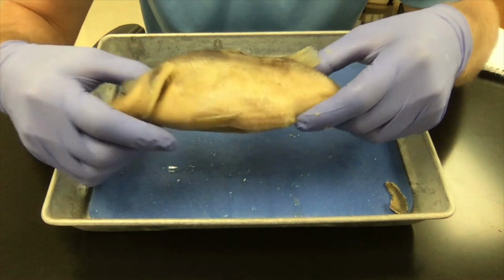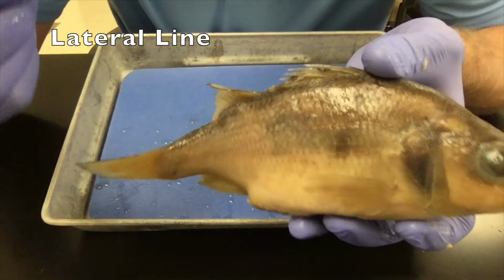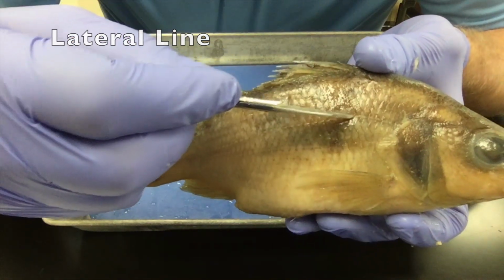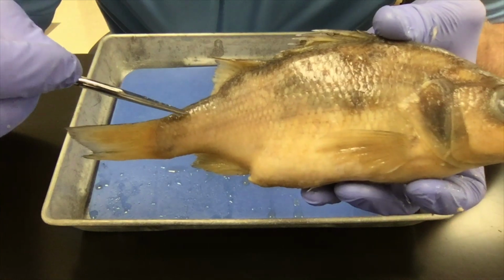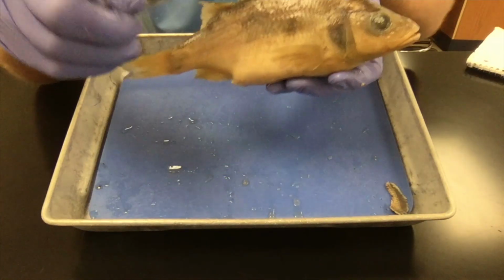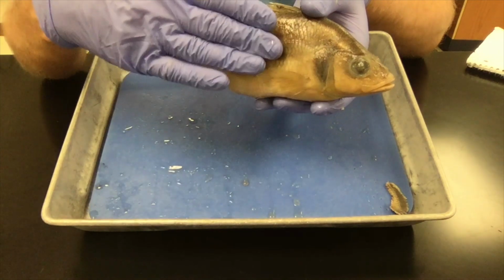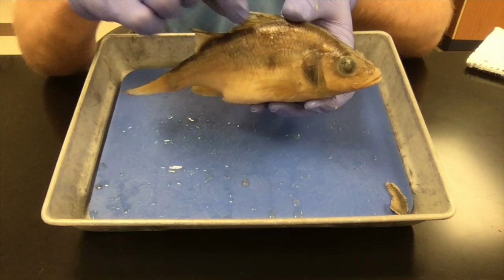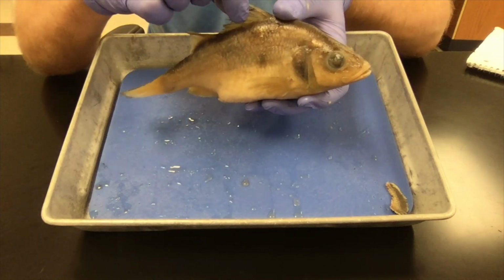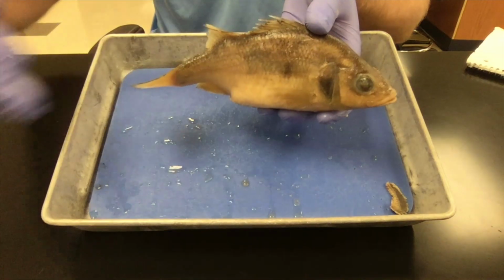Also on the outside of the fish is a unique structure called the lateral line. You can see the lateral line right here. It's sort of like a little line of holes that runs down the side of the fish. These holes are filled with little, almost hair-like structures that are very, very sensitive. Whenever water hits the lateral line, the fish can feel the water moving. So it's sort of like an extra sensory organ that helps the fish to feel everything in the water around him.